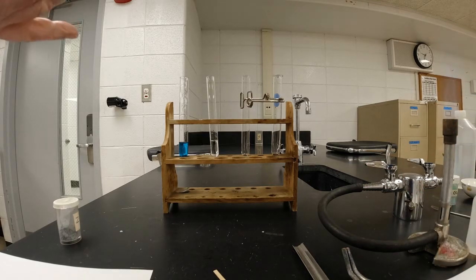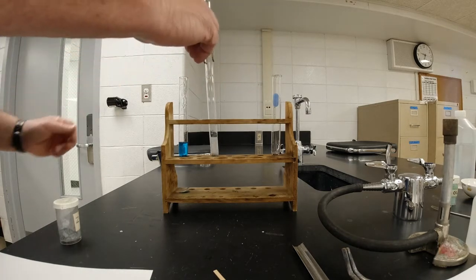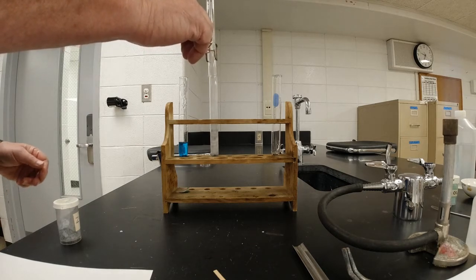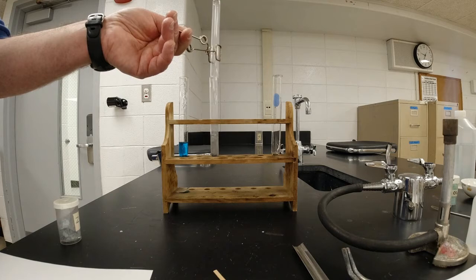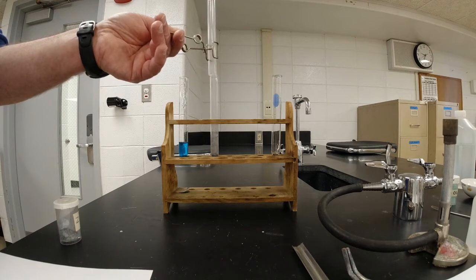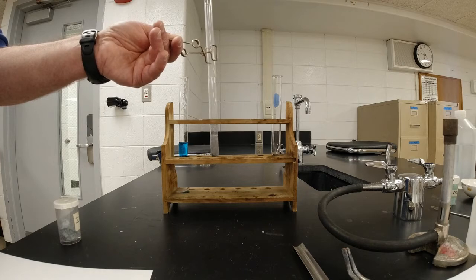All right, I'm going to drop my zinc in here, and I need to be ready to start catching the gas immediately. And it is bubbling like crazy. So I'm going to let this bubble and bubble and bubble, for about 1 or 2 minutes. That's a pretty violent reaction. If I touch the bottom of the test tube, it would be hot. We've done that before in here. It's continuing to bubble.